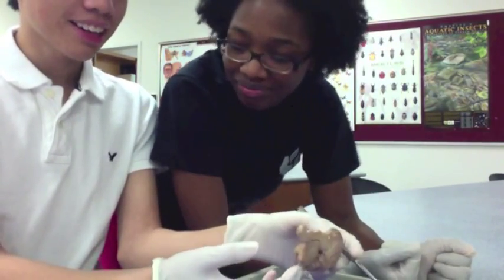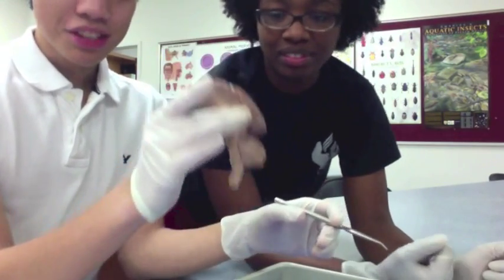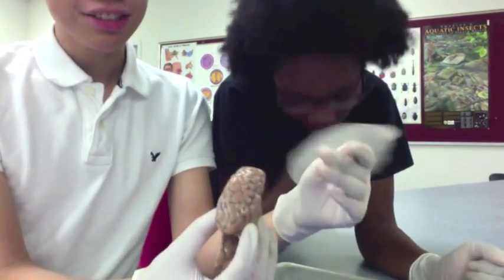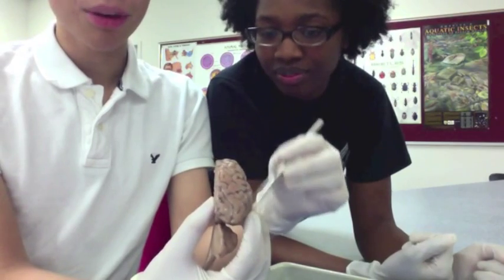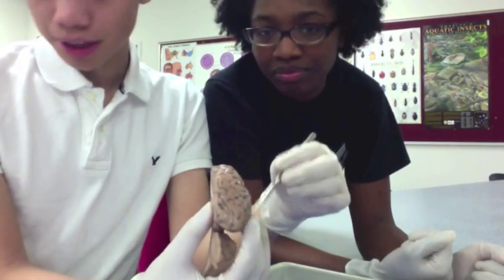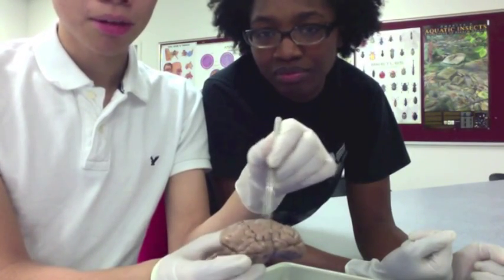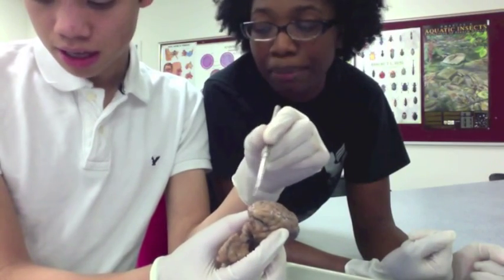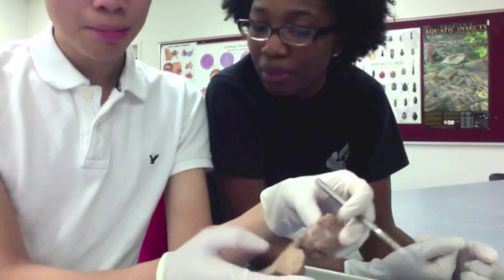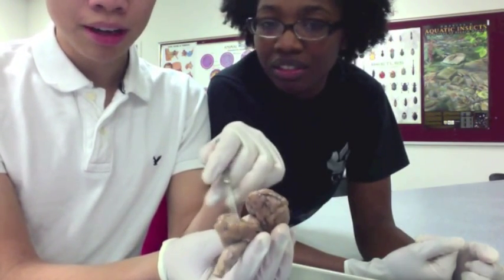This is Lab 9 dissection, and this is on the sheep brain. So, this is your sheep brain. You have, first, your cerebral hemisphere, which is pretty much one side of your cerebrum. You, of course, have the frontal lobe, which is the front part, parietal is in the middle part, and your occipital lobe is in the back. You have your cerebellum, which is this little part right here.